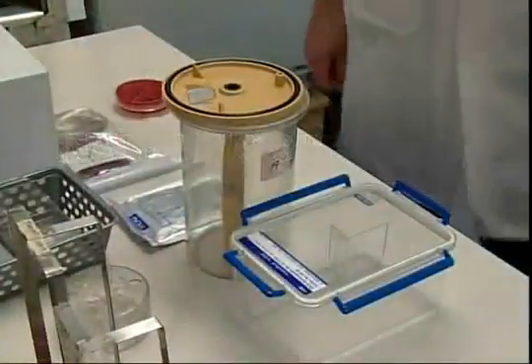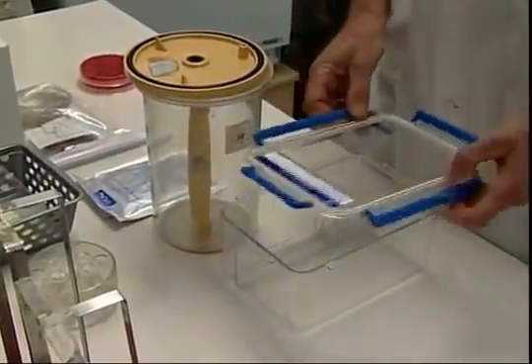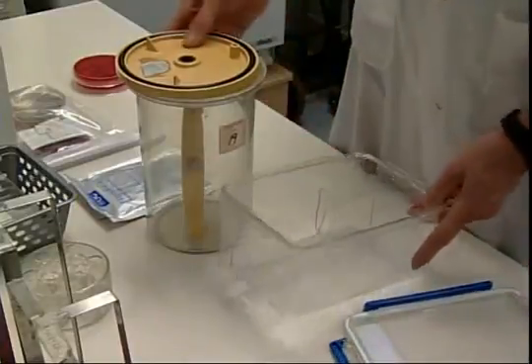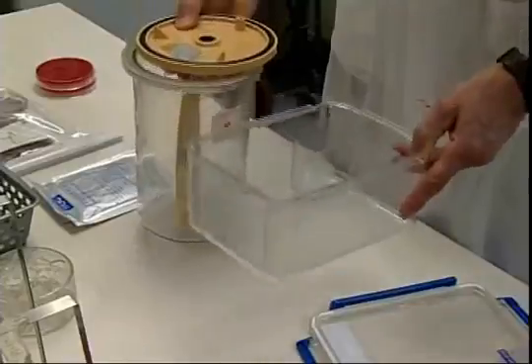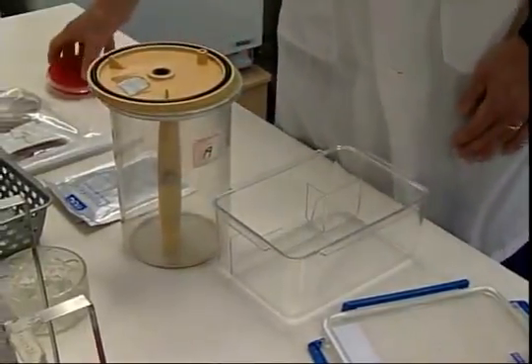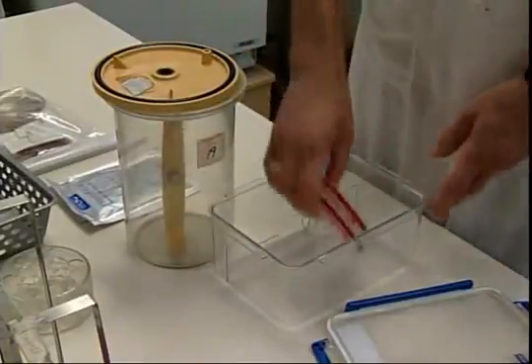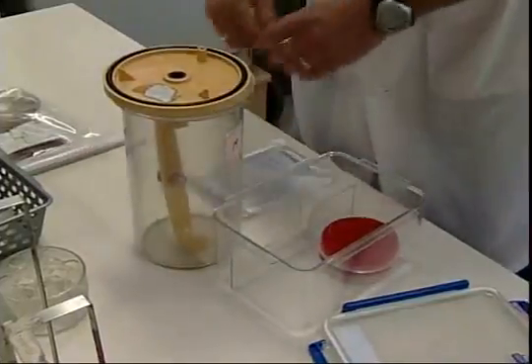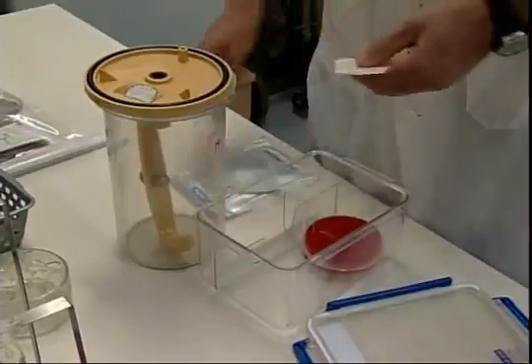Lastly, we want to address the anaerobic requirements of bacteria. Anaerobic bacteria will die in the presence of oxygen, and so we utilize containers such as these two, an anaerobic jar and an anaerobic box, to create anaerobic conditions to enable anaerobic bacteria to grow. And once we've inoculated these plates with the swab, we'll put them into the container. We'll put an indicator in to tell us whether anaerobic conditions will be met.